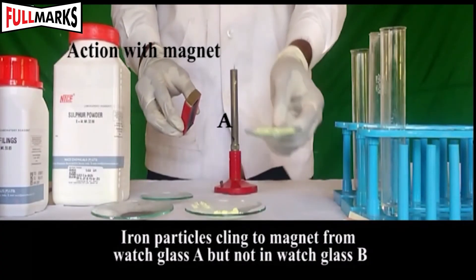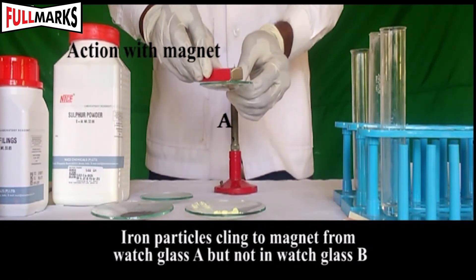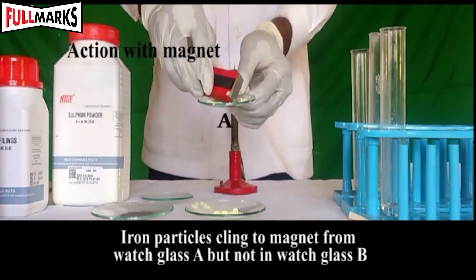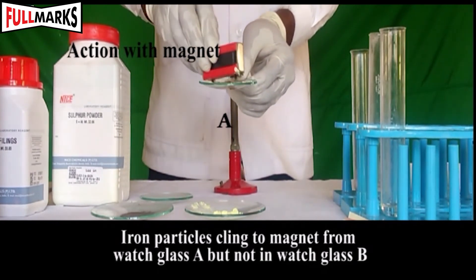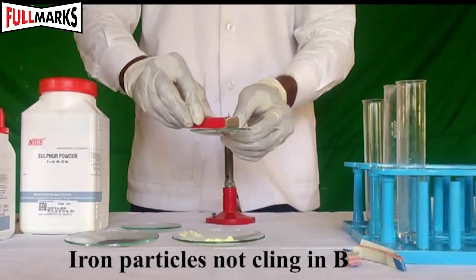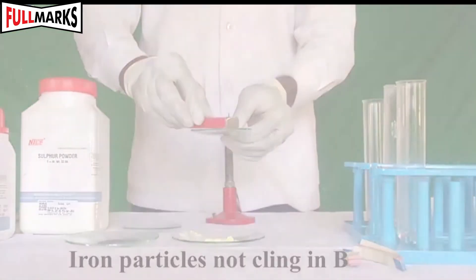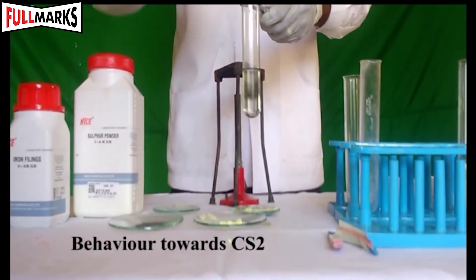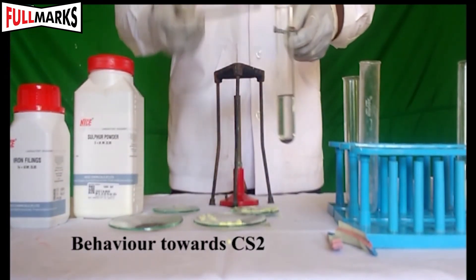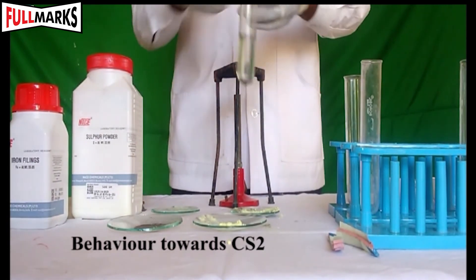Action with magnet: A bar magnet is rolled over both watch glasses A and B. Iron particles cling to the magnet from watch glass A, but not from watch glass B.